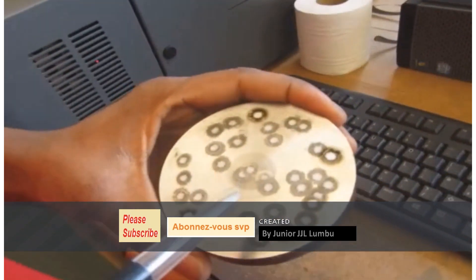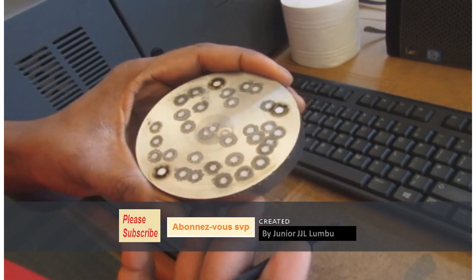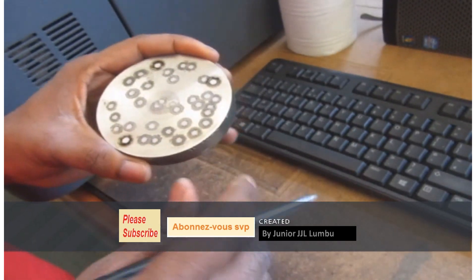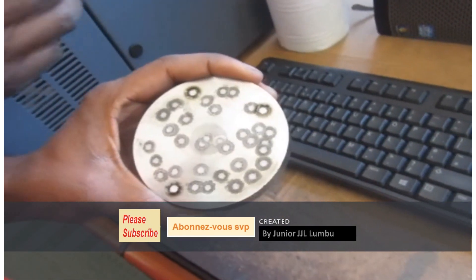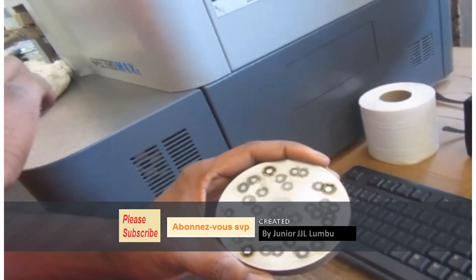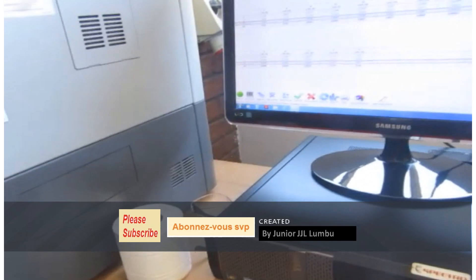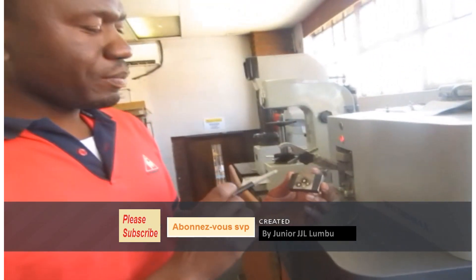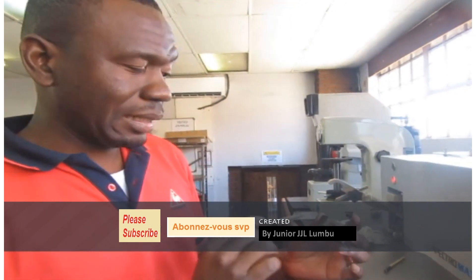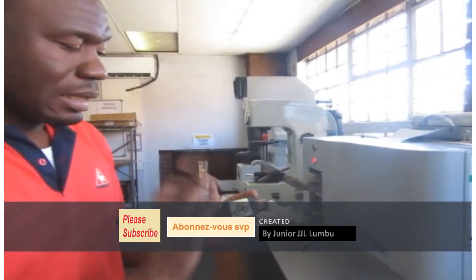This is how the spark looks like after it has been sent on the sample. It emits radiation back, and based on the wavelength of that radiation, this machine has the ability to determine which element is which and what percentage it has. These are the three spots I did, and I'm going to get the average of the three.